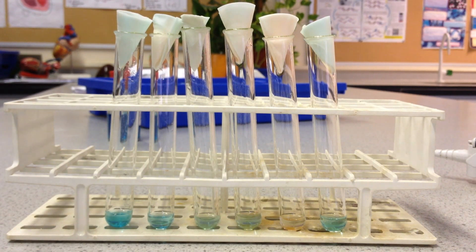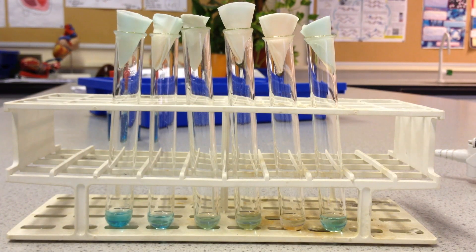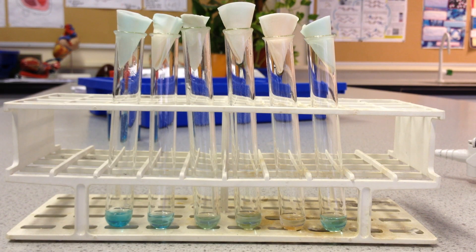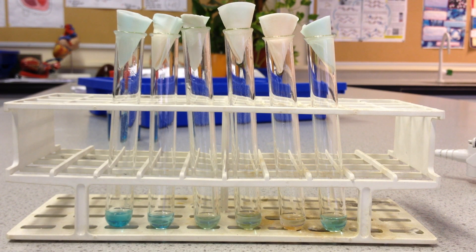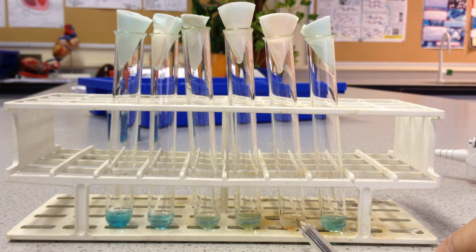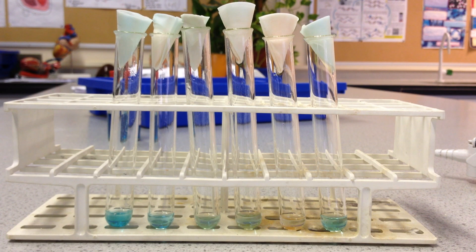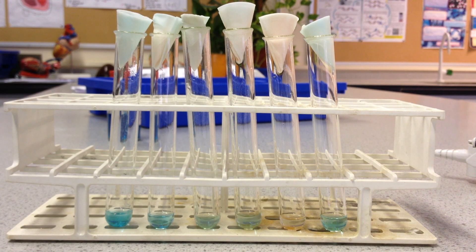I've filtered away all the precipitate by pouring the solutions through filter paper into a second test tube, removing all the red precipitate. What's left is just the remaining copper ions in solution. We're looking at a more uniform set of solutions where the only difference is the amount of copper left. As the concentration of glucose got higher, more and more copper reacted. This one is our test solution, and we'll compare its colour to the others using colorimetry.